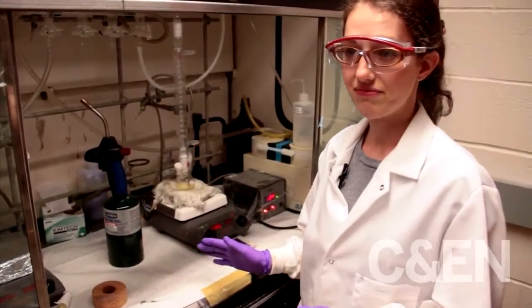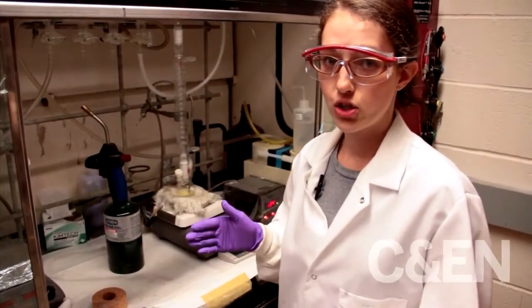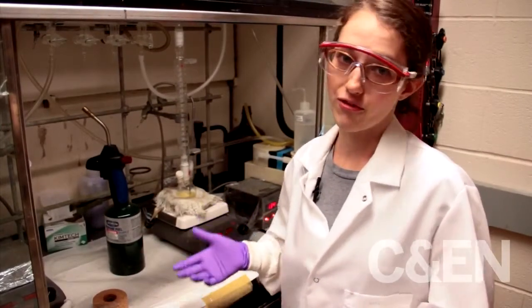So now that that's ready, I'm going to go and head over to make the selenium for the injection.